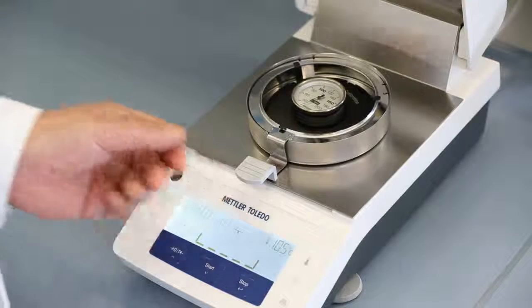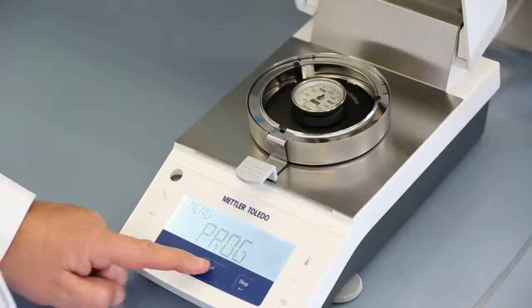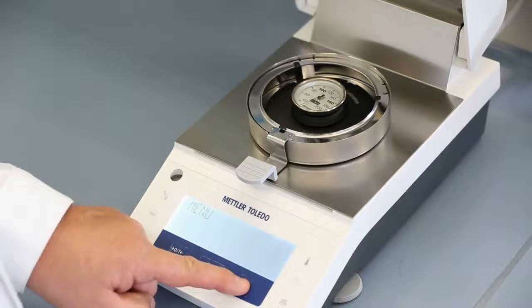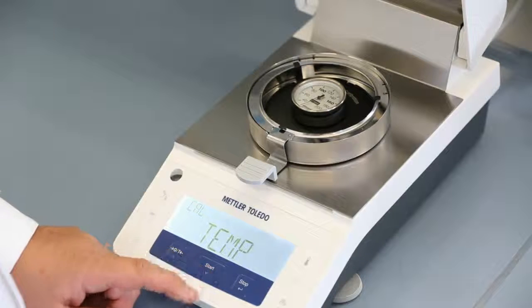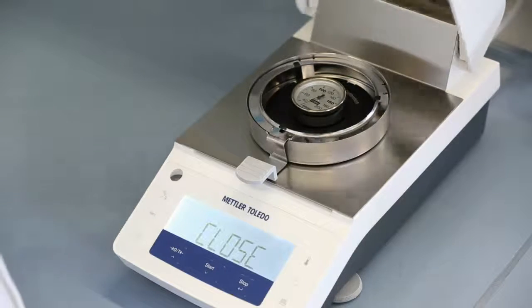Press the menu button, scroll to calibration menu and select temperature calibration. And close the lid to start this adjustment.